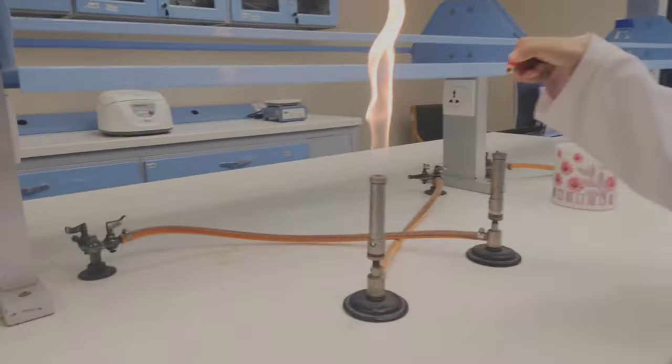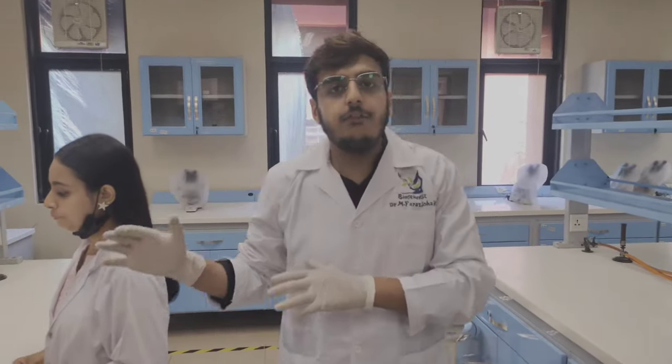Now our step is to create an aseptic zone. This step is performed to protect us from every kind of contamination of microorganisms.